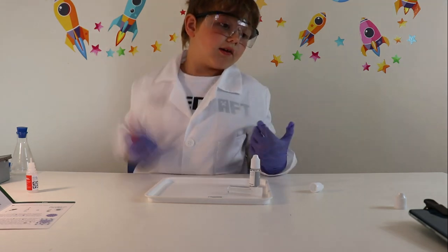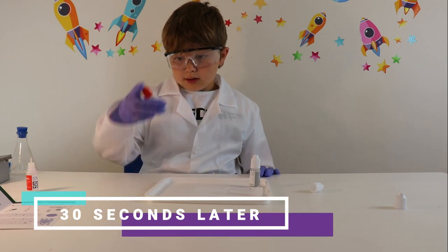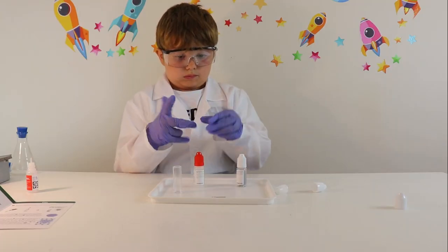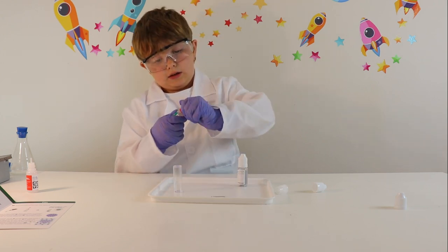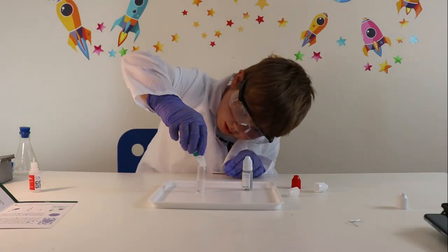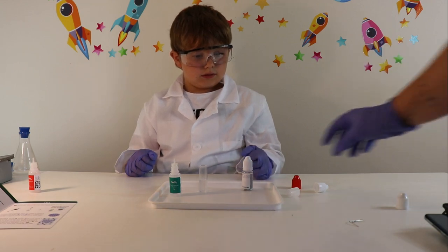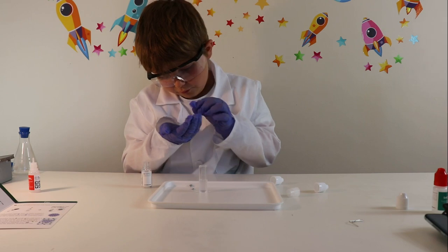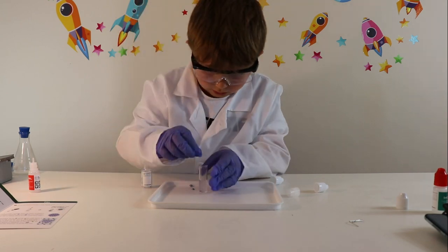So now there should be a clear plastic vial on your tray, and can you fill it halfway with the solution that you've just shaken? So can you get that cap off, fill that halfway — that's about right. Now take one pellet from the zinc bottle — oh how exciting, they look like so many! So carefully place the pellet inside that vial.